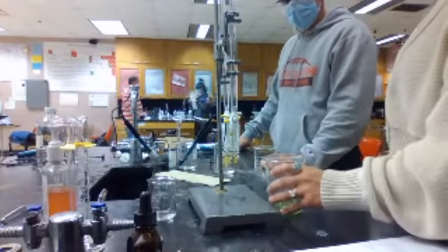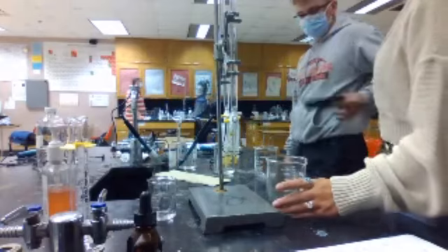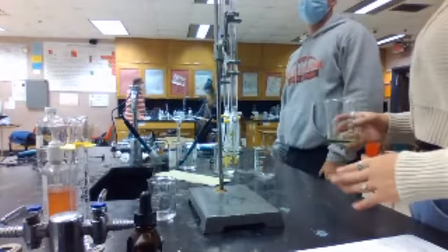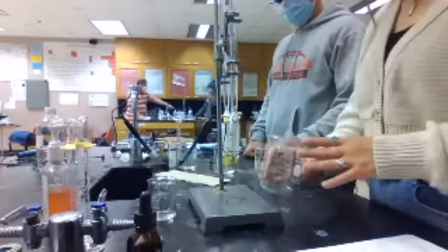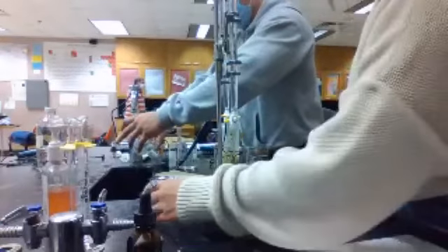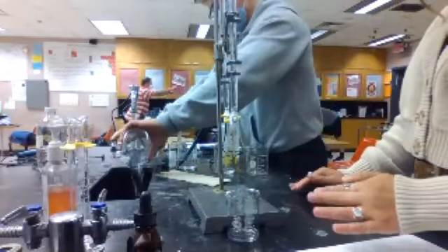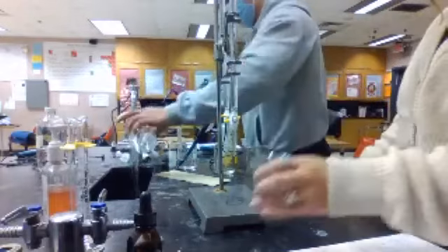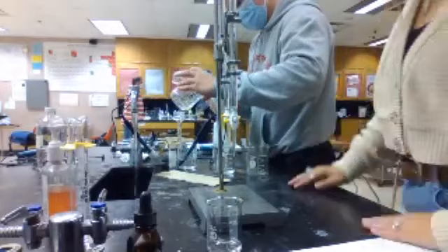Yeah, pretty much. So let's get one more in. If we get one more in, that'll be happy. I'm still scared. So I should pour this out. But I don't need to clean it, right? Or should I? Let's take that because it has a base in it. So we're redoing the same. Don't pour any more in because you've got to use this, or we're pouring it out by the end of this day. All we have left is that. So hopefully we have enough for you to finish your trials after the other classes visit.